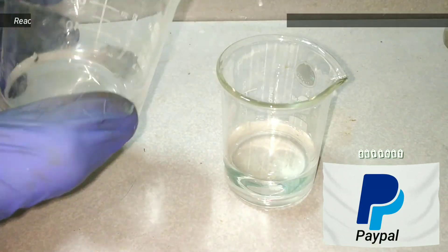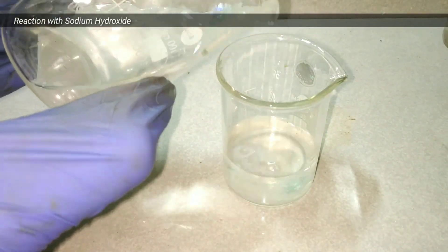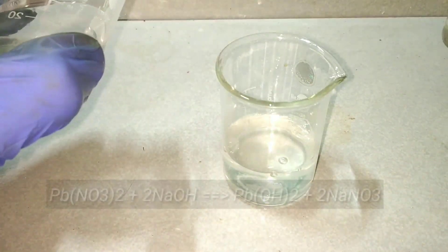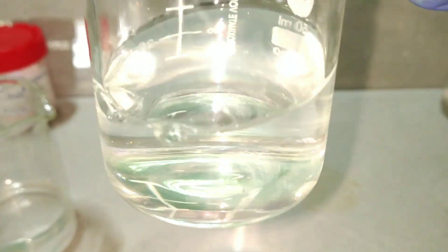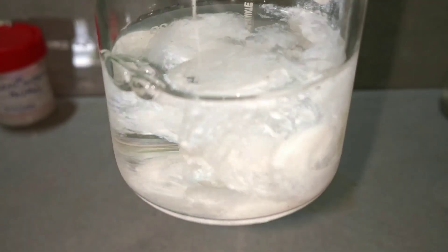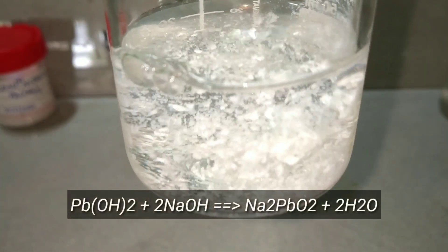Lead(II) nitrate reacts with sodium hydroxide forming a white precipitate of lead(II) hydroxide. The initially formed lead(II) hydroxide precipitate gets dissolved due to excess sodium hydroxide to form a colorless solution called sodium plumbate(II), as you can see in the reaction.